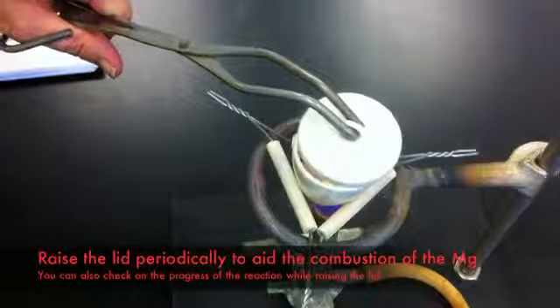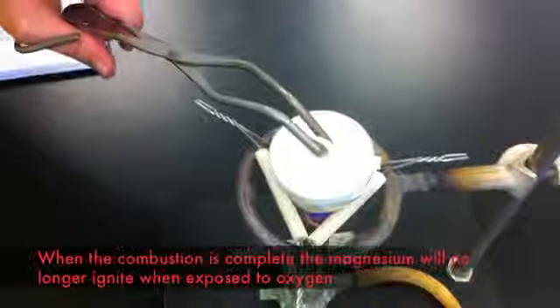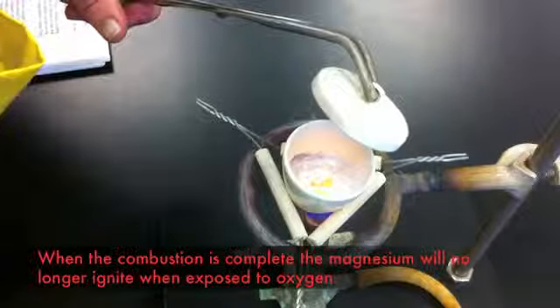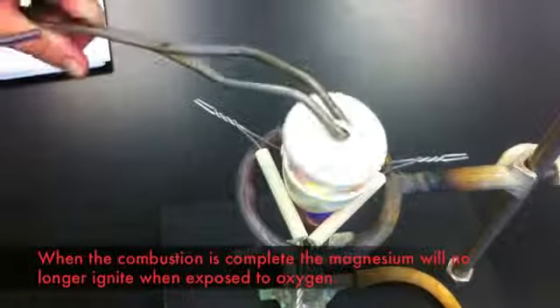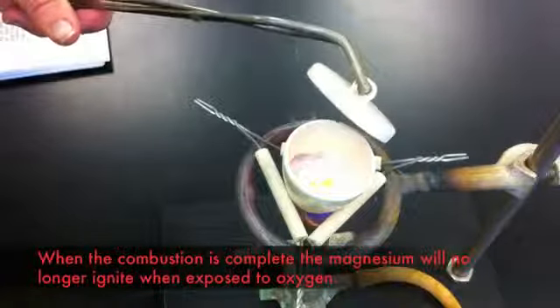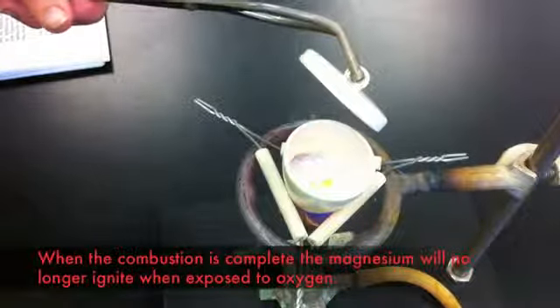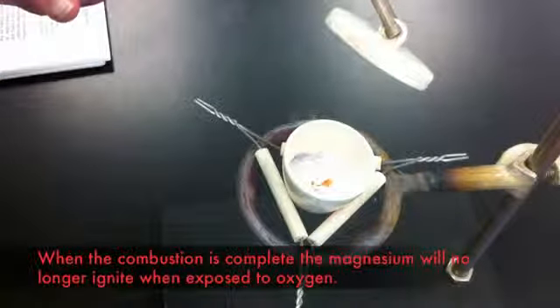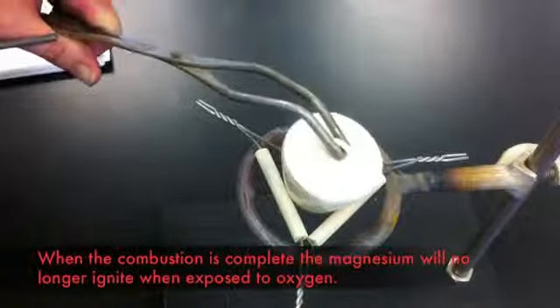Allow the reaction to proceed, periodically checking on it to see whether or not ignition occurs when the lid is raised. When ignition finally ceases, you know that the reaction is done. At the moment you can see this is still glowing hot, but no ignition is taking place, so we know that the reaction is done. You can turn off the Bunsen burner and leave the crucible to cool. Allow it to cool completely before proceeding with the next step.